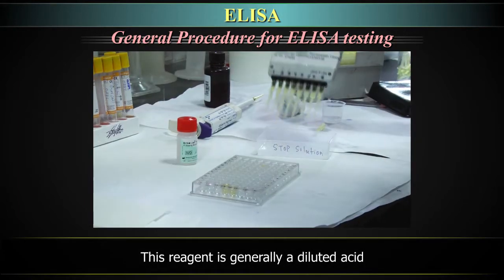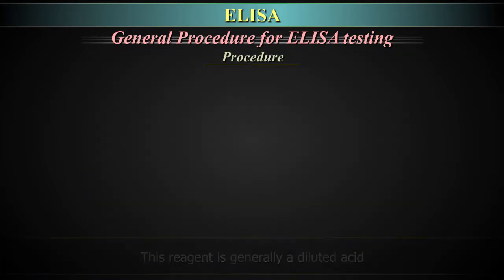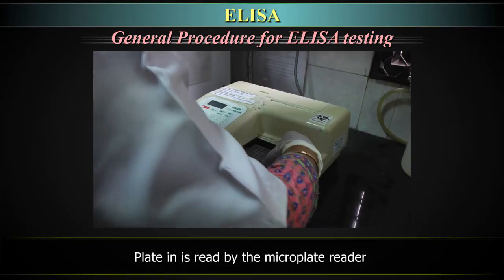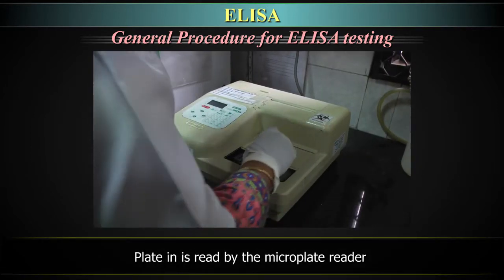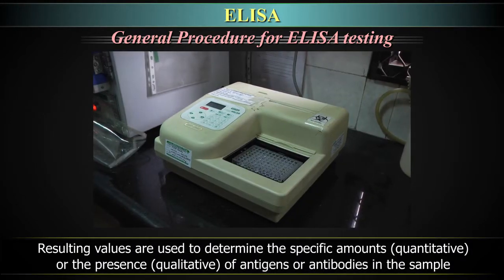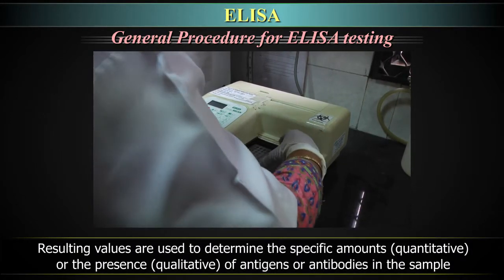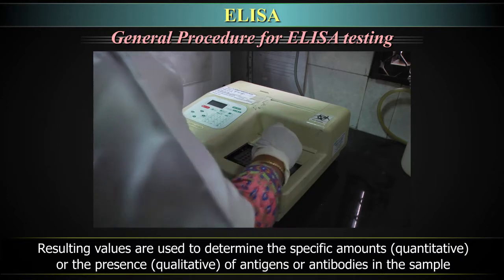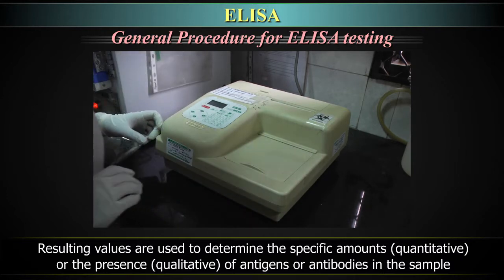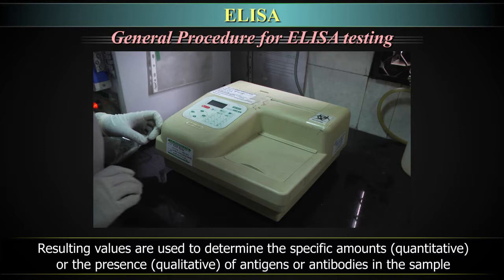This stop reagent is generally a diluted acid. Finally, the plate is read by the microplate reader. The resulting values are used to determine the specific amounts, i.e. quantitative, or the presence, i.e. qualitative, of antigens or antibodies in the sample.